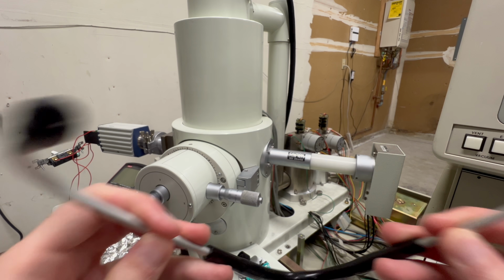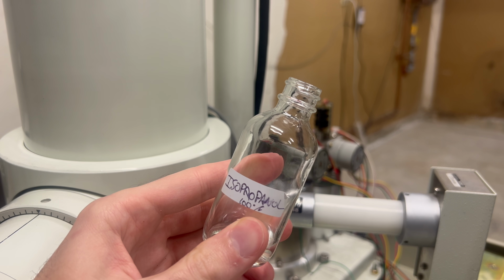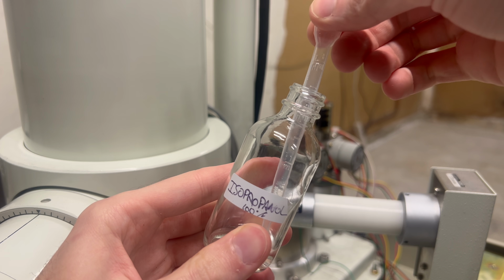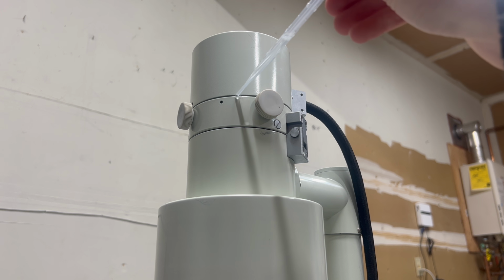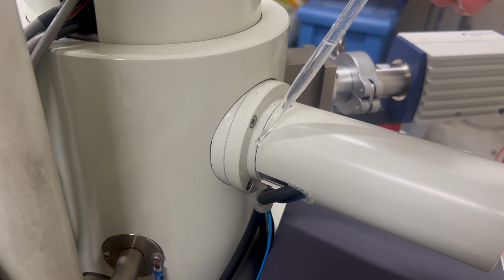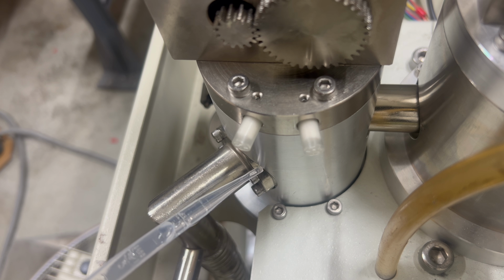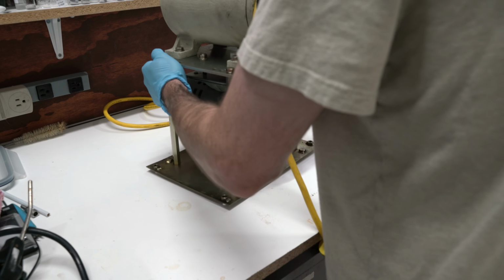I also tried using a stethoscope to hear the leak, but to no avail. I even tried flooding the various connections with 100% isopropanol, which is another method to check for leaks. The isopropanol, if sucked in, will vaporize and cause a spike on the pressure gauge. However, I got nowhere. Every joint on the machine seems vacuum tight. Then I realized my error.